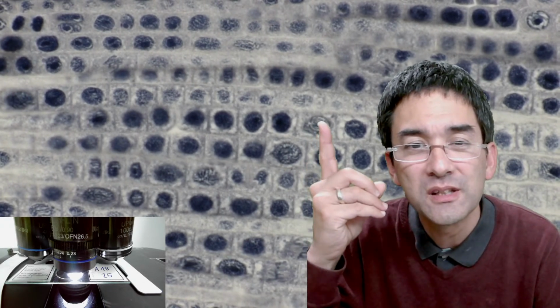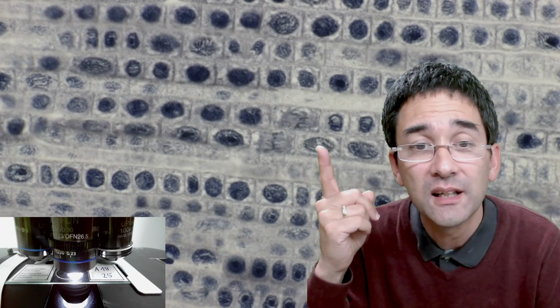But those chromosomes are still scattered around in the cell. They're not in any order, they're just randomly there. And therefore, the cell has to pull them to the equator, to the center of the cell, to create symmetry, just like I showed you over here. So this one at the top was probably, or maybe this one over here as well, could be a prophase cell. You see that it's not quite as dark as the other cells, and there are those tiny lines in there, which could be the chromosomes.